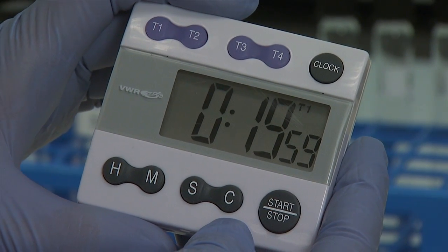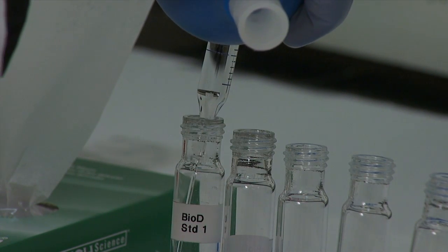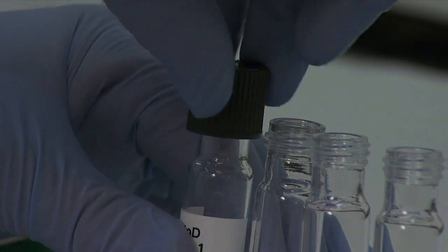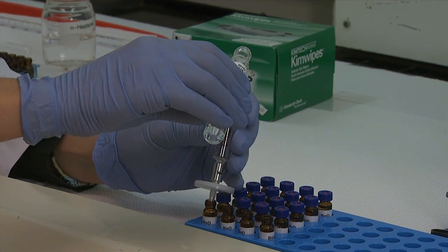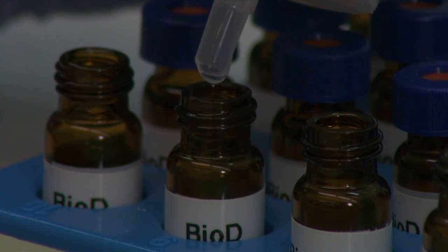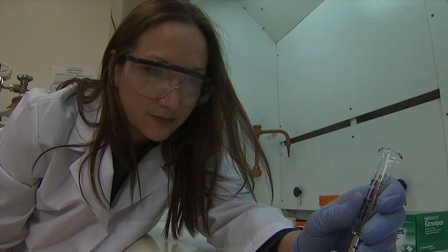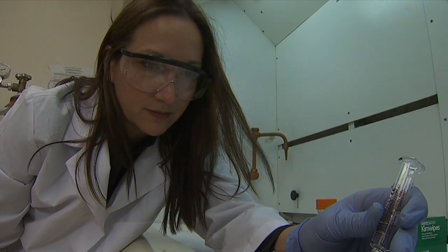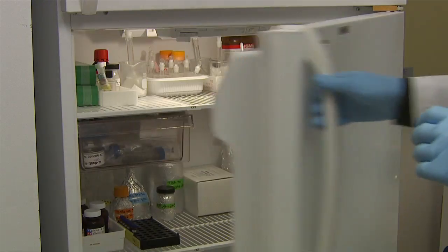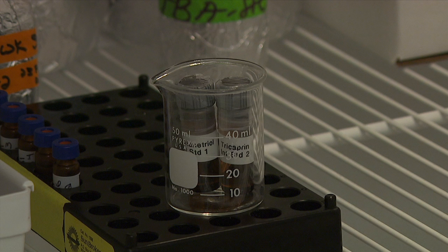Allow the vials to stand at room temperature for 20 minutes. After all five vials have stood for 20 minutes, add 8 milliliters of normal heptane to each vial. Securely cap and vortex or shake vigorously. Syringe filter each standard into labeled GC vials, about 1.5 milliliters into each GC vial. The total volume of each standard solution is approximately 9.3 milliliters, so several GC vials will be required. Use a new filter for each standard. Store vials in the refrigerator until analysis. Store the remaining internal standards in a sealed vial in the refrigerator for further use. Refer to the manufacturer's package insert for expiration dates.